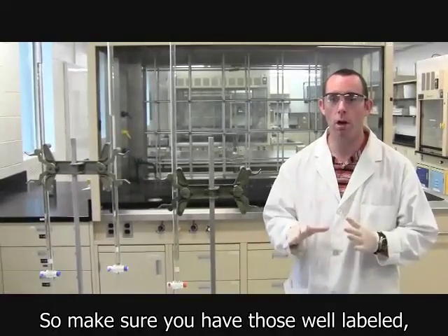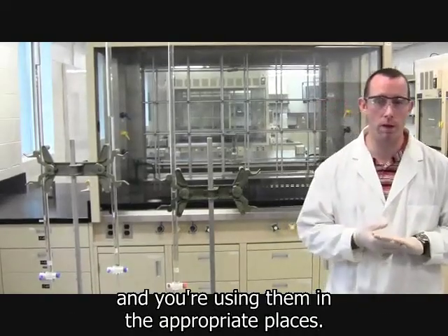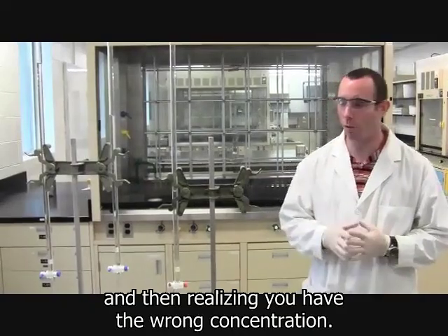Okay, so make sure you have those well labeled and you get them at the right times and you're using them in the appropriate places. Nothing worse than making all of your samples and then realizing you have the wrong concentration.